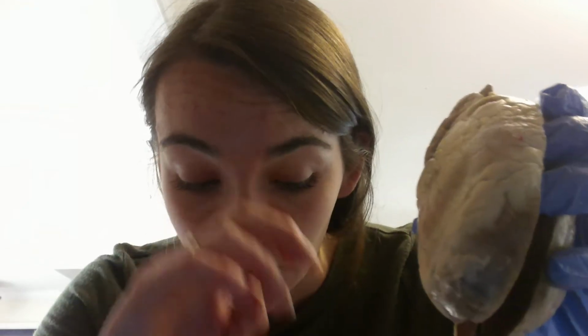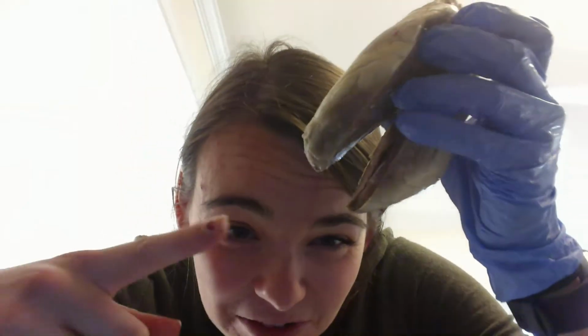And so the right ventricle is responsible for pumping blood through the pulmonary artery to the pulmonary circuit, and there's a valve there called the pulmonic valve that prevents backflow from the pulmonary artery to the right ventricle. And also there's another valve called a tricuspid valve that is between the right atrium and the right ventricle. Kind of hard to see the way I have it angled, but it's in there. And that is responsible for preventing backflow from the right ventricle to the right atrium.